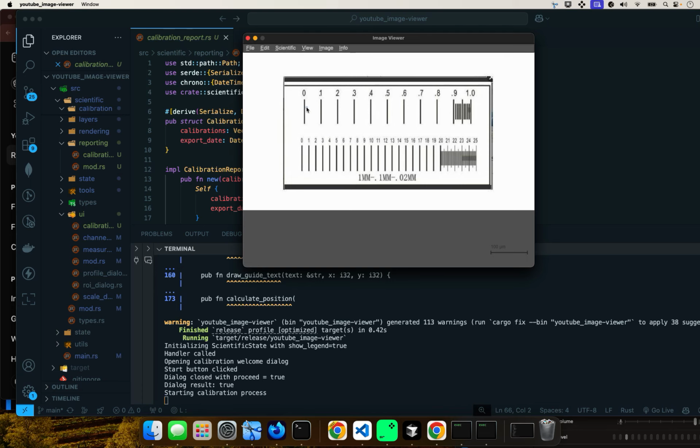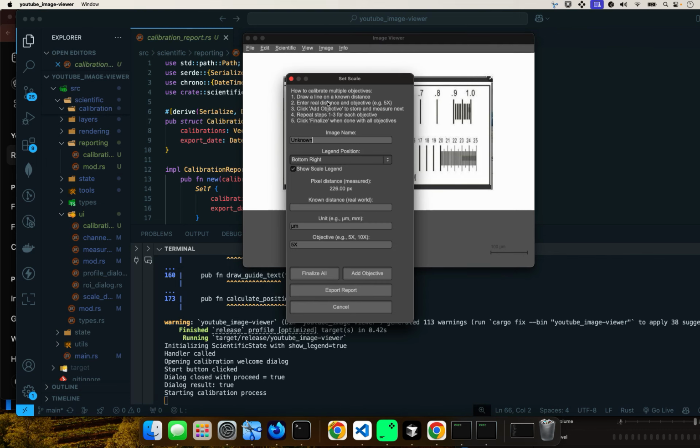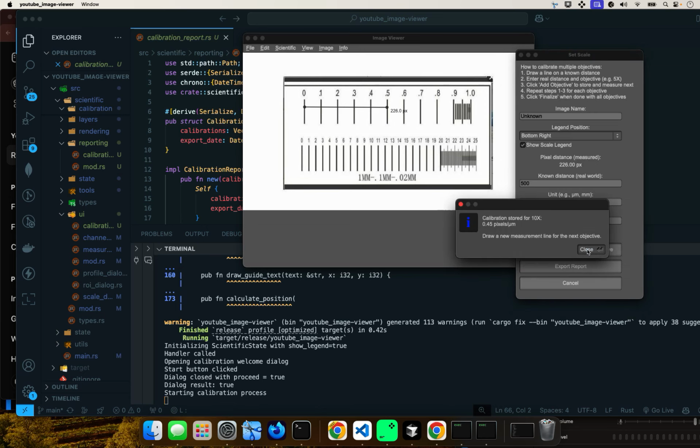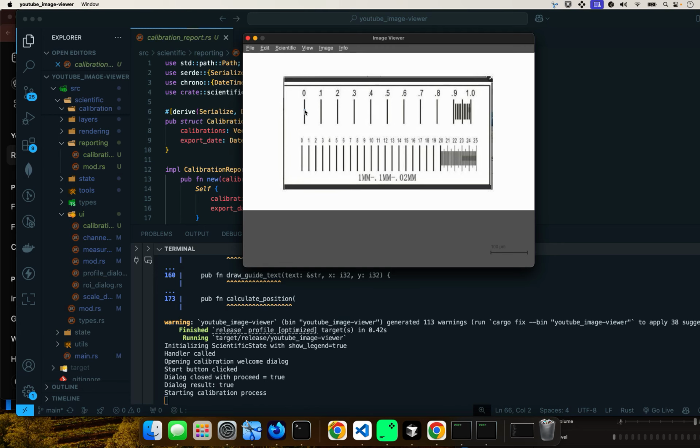So that was 1000. Now, if you were using a microscope, this would be a different magnification. Let's keep the math simple, just by half. So this would be, let's say, 500. So let's do 500. This will be the 10x objective. And add another objective. So that's 500. We'll do close, and now we'll do it again.